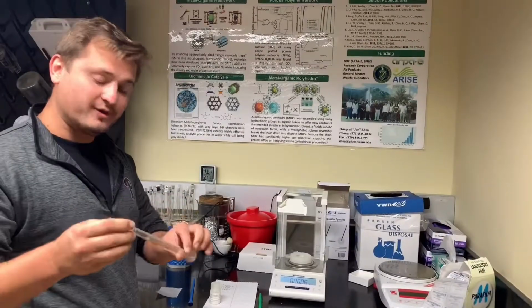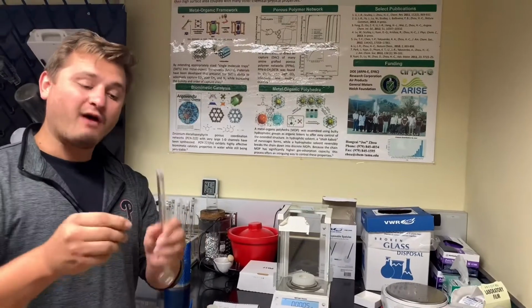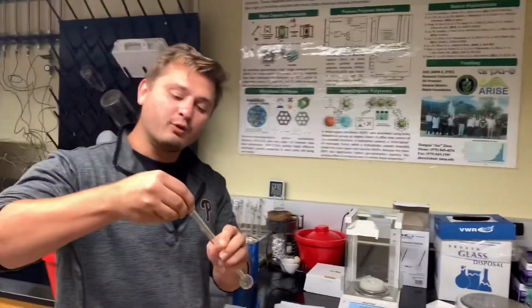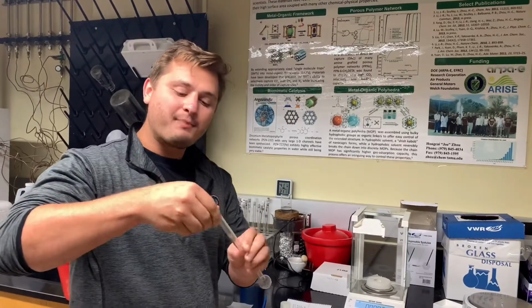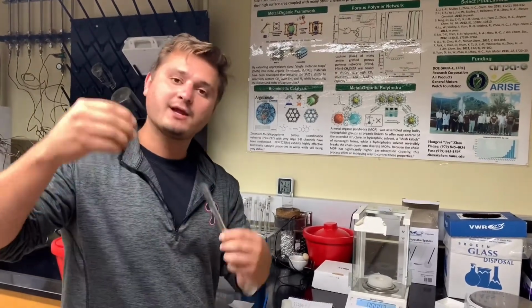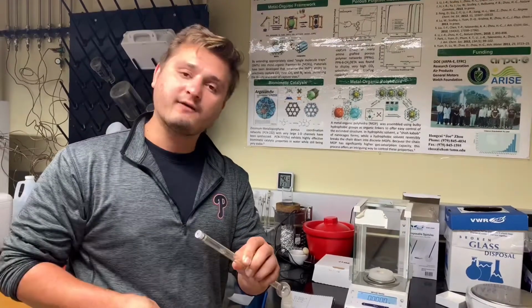Next thing that we do is to load the sample into the tube. In order to get the top off and put the top on, there's a very simple way. You don't want to just shove it on and press it as fast or as hard as you can. By pulling and twisting a little bit, you get the sample top off very simply. Or by pushing and twisting, it goes on very simply as well.